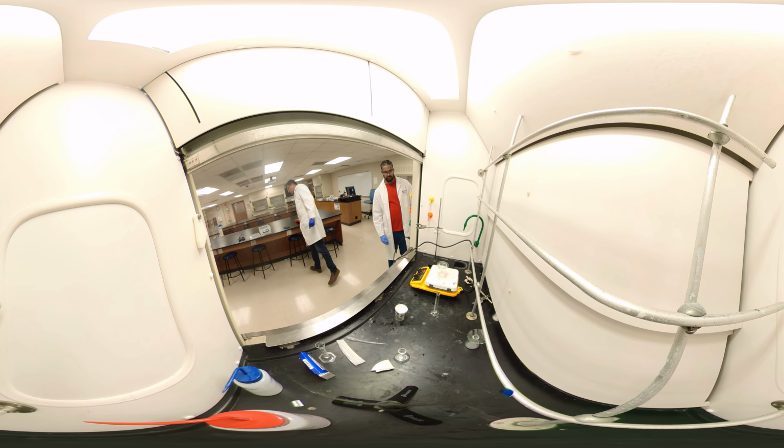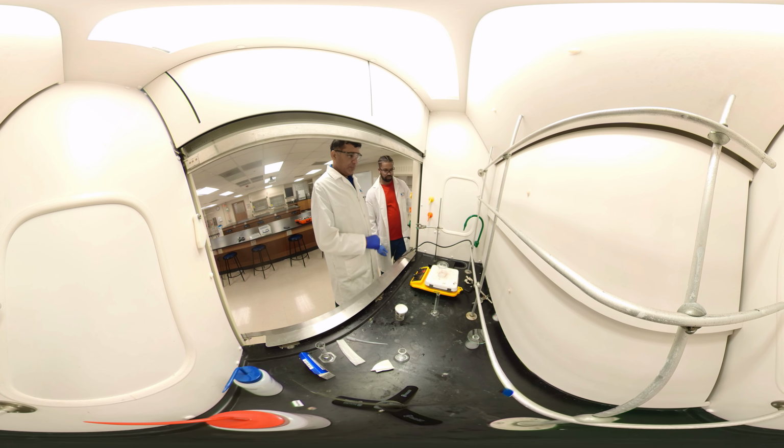What are you looking for when you heat it up? What are you trying to bring it to? Yeah, we have to heat it up so it dissolves acetaminophen and the binder remains the solid. Once you filter, binder separated and acetaminophen goes to the liquid. And once you evaporate the solvent, then you have your solid separated.